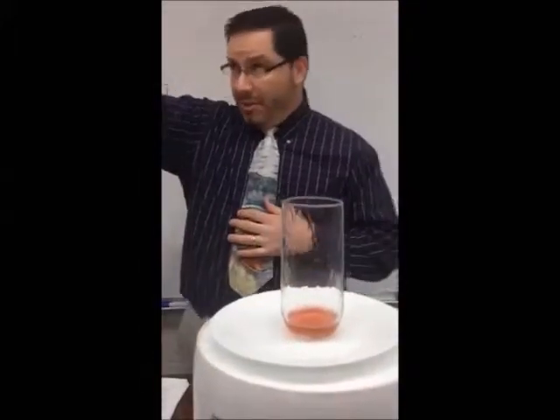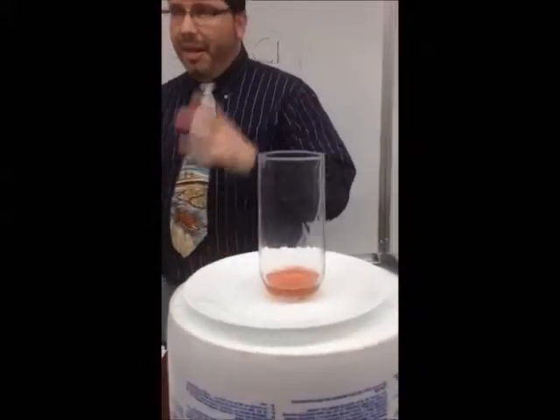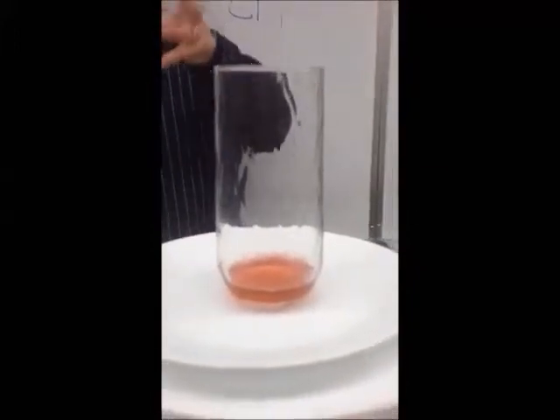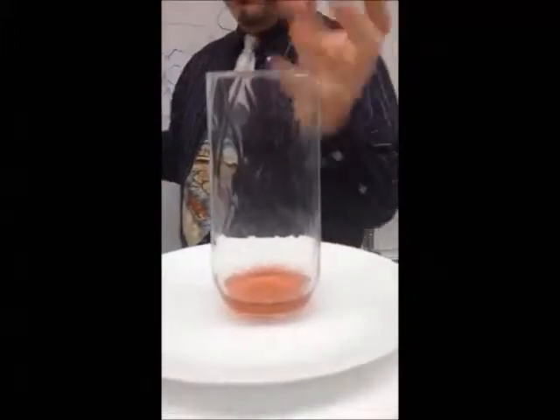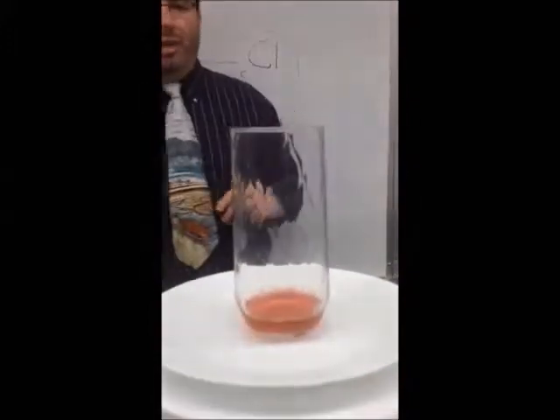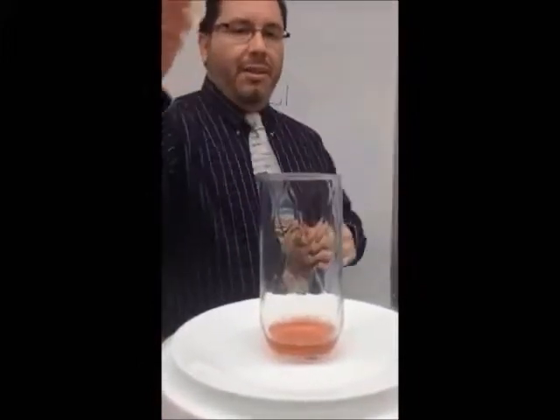And look how much, it's just that little bit. So zoom in on that. You can all see that little bit at the bottom there. So here we go. Here's a chemical reaction. An exothermic reaction, it's going to give off heat. You might also see a change in color. We have a very light reddish color right there. So watch how quickly it changes color, and then watch what happens next.